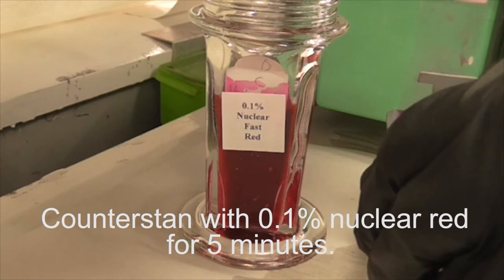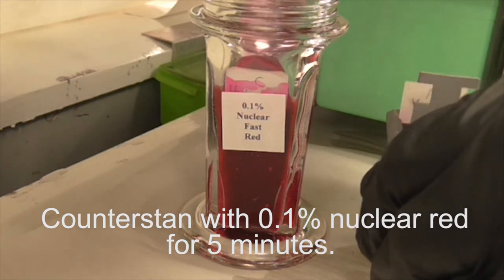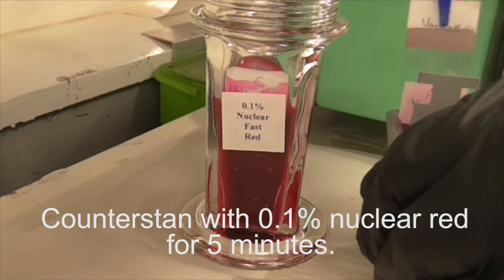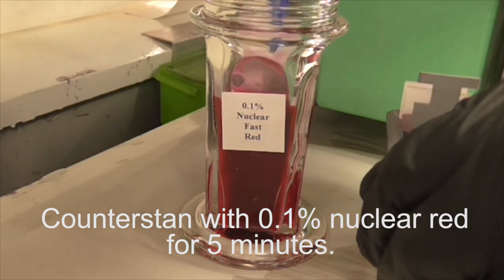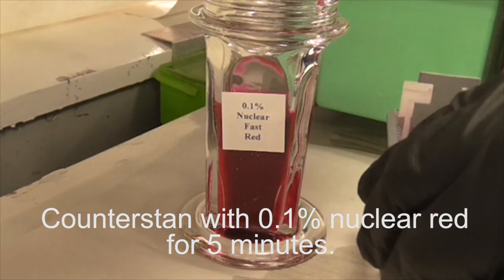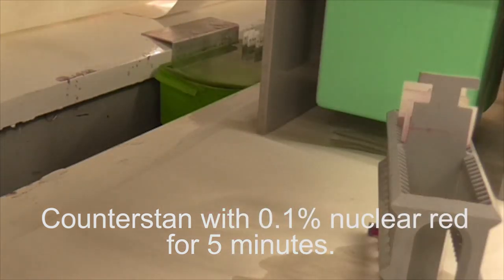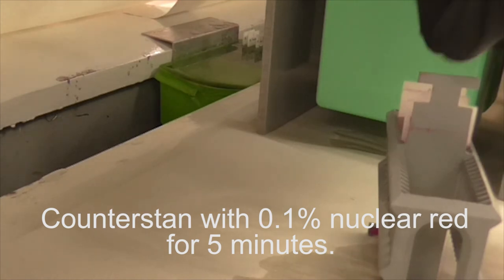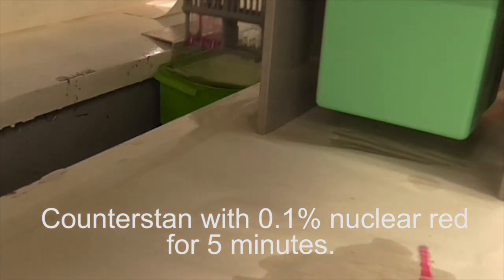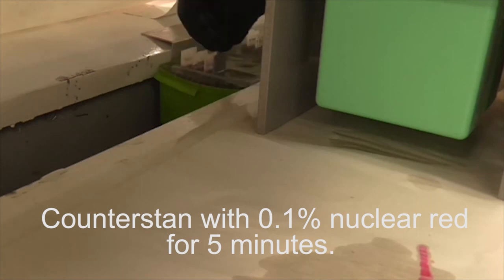Once the timer goes off at 5 minutes, we will be removing the tissue sections from the nuclear fast red and placing them into racks. Place this rack with the slides in running tap water and wash off any remaining nuclear fast red solution that may be present.